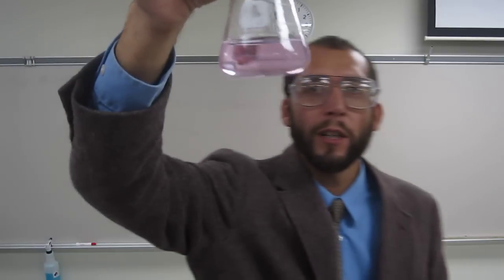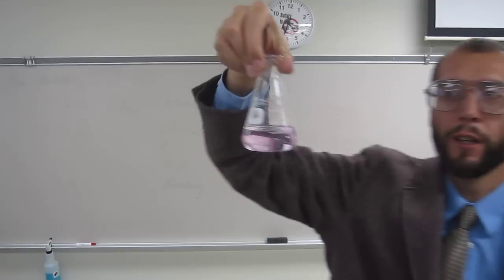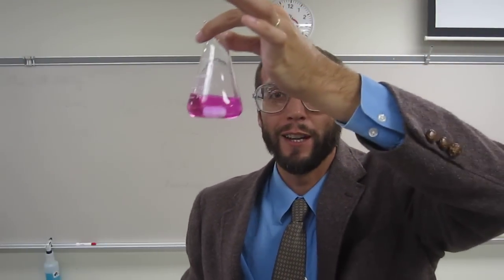Okay, guys, I just want to show you what the phenolphthalein titration endpoint should look like. So really, really light pink, okay? Barely can see it. So hopefully you guys can see it, right? Not like this. Dark, dark pink. Way too far, okay? It's good. That's a good one. Yeah, definitely.